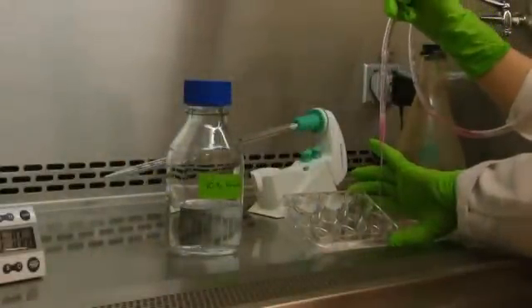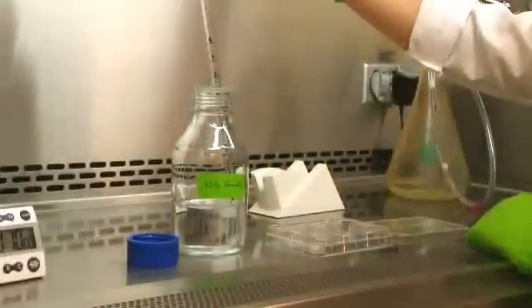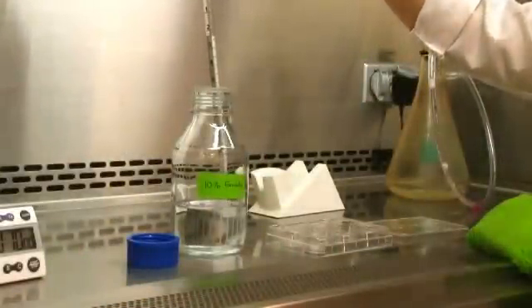On this first day of ICC, we will fix, permeabilize, block, and add a primary antibody to the cells.